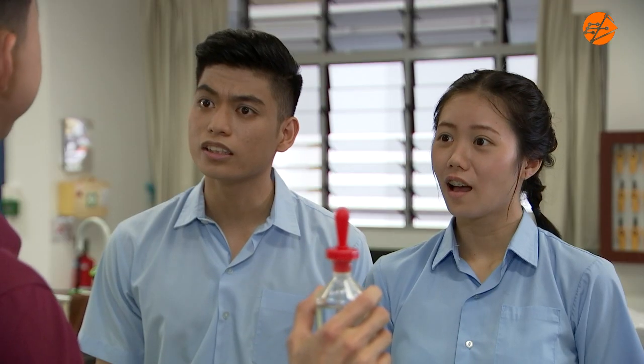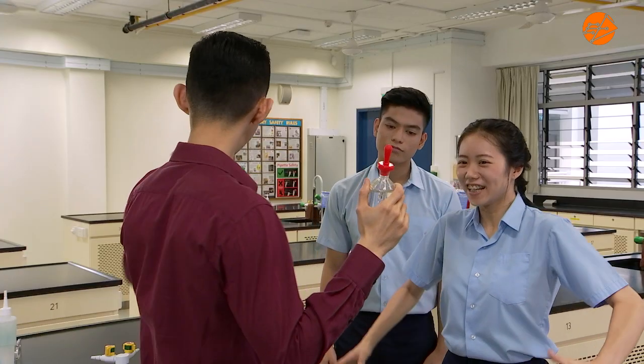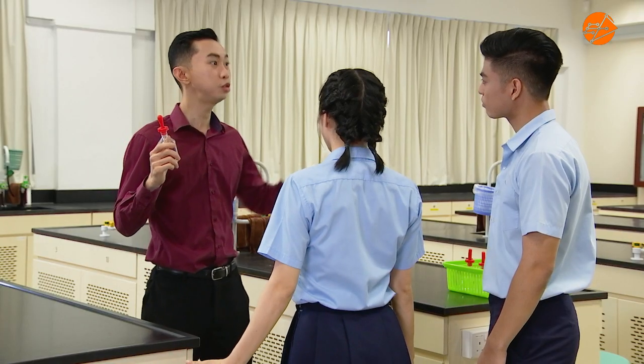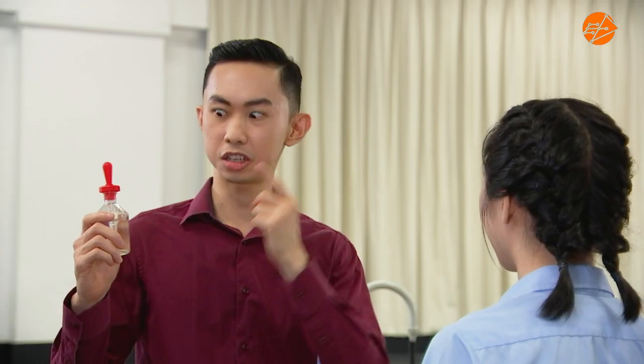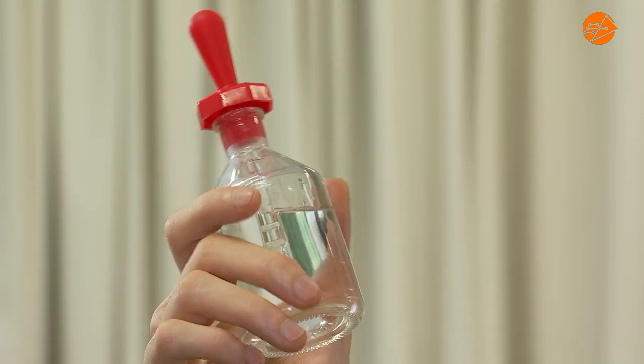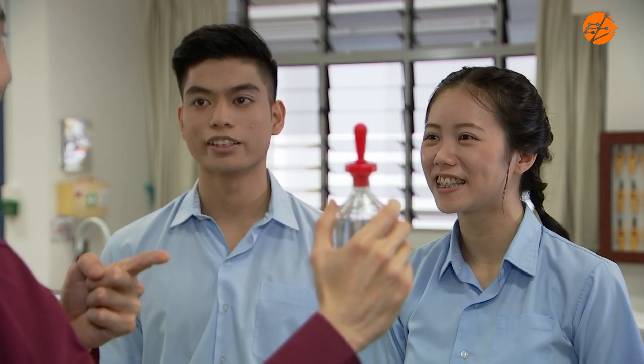Adam, Amy, I have an idea. Let's figure out this mystery together. Are we going to conduct an experiment? Yes. Let's put our investigative spirit to work. We will conduct some experiments to determine the identity of this colourless solution. I love doing experiments.